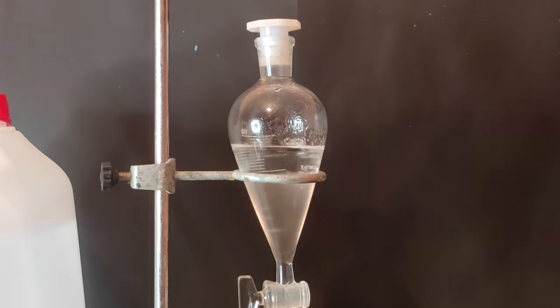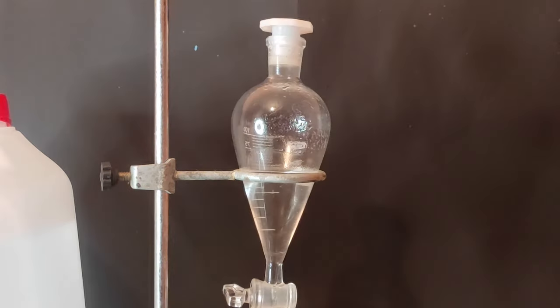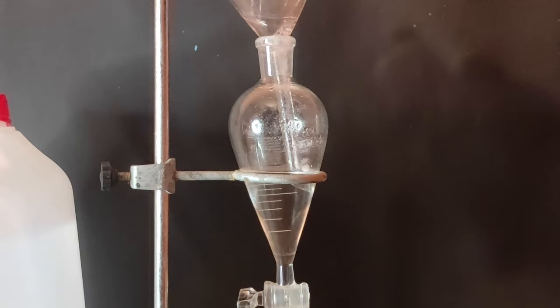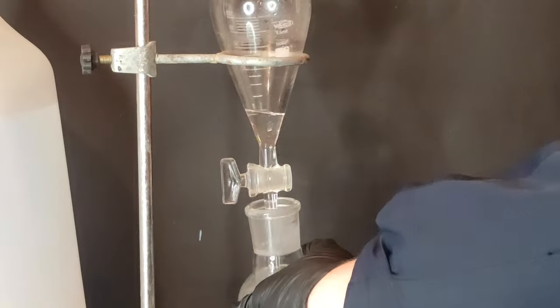For a while I thought that something was wrong with what I was doing because those air bubbles were coming in, but it turns out that was because I've had the funnel capped. I've decided to wash the nicotine solution 3 more times with diethyl ether and I've collected all of the ether layer.